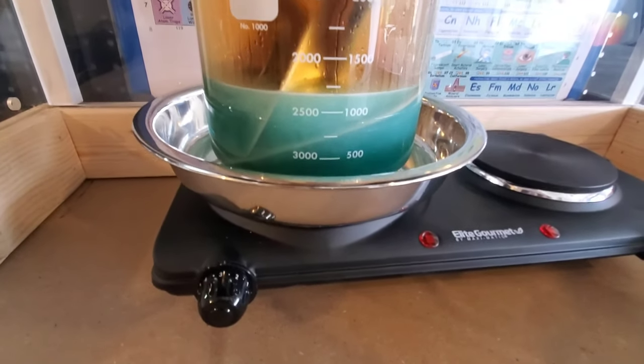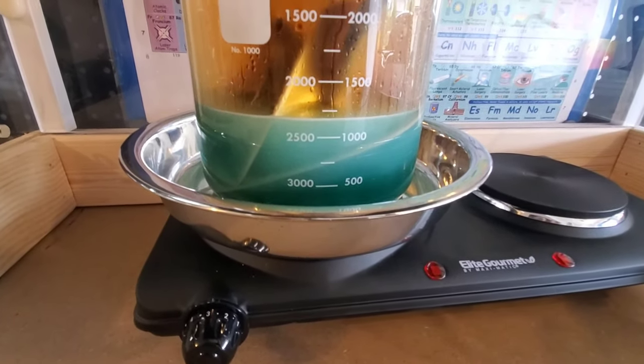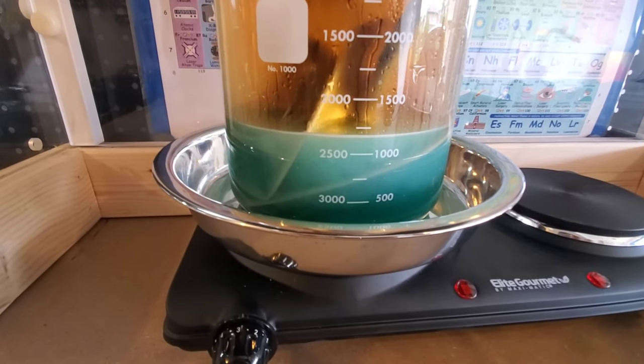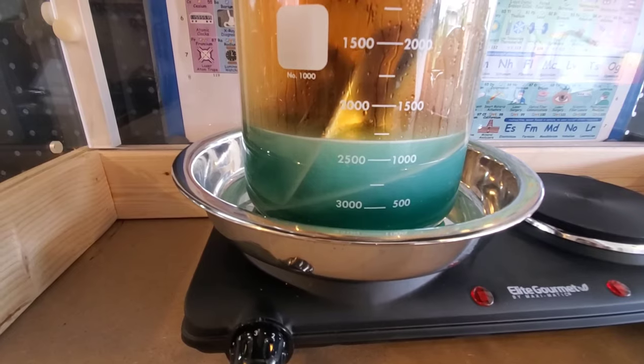All right the elapsed time is now about 40 minutes. You can really see the reaction is going well now. And that silver is breaking down into the silver nitrate.